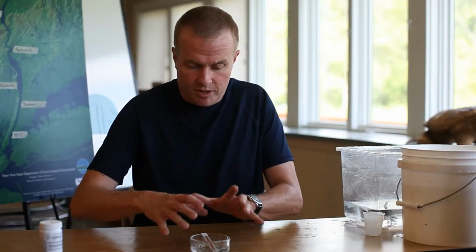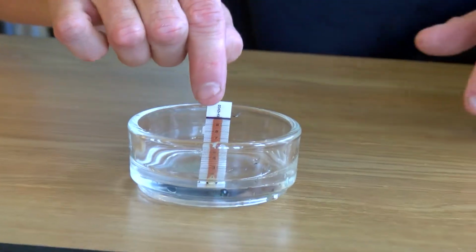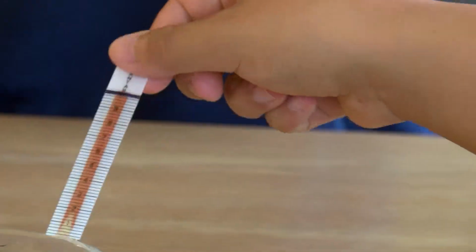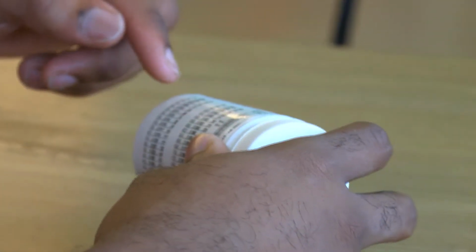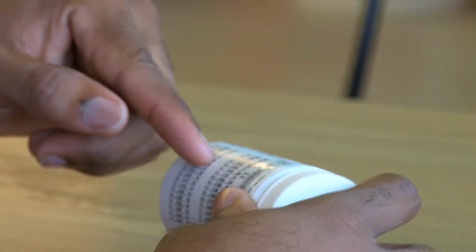Now our Quantab strip, it's taken 5 or 10 minutes, but that little yellow stripe has now turned a dark blue, almost black, which means the reaction is done. So Michelle, pick up that Quantab and tell us that little white triangle at the bottom, what number does that go up to? 1.8. Now Martise, on our bottle, there's a label. Find out, what does 1.8 mean? 1.8, that means 51 parts per million chlorides. 51 parts per million of chloride.